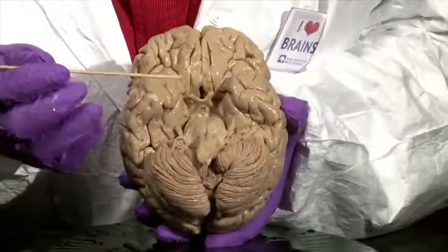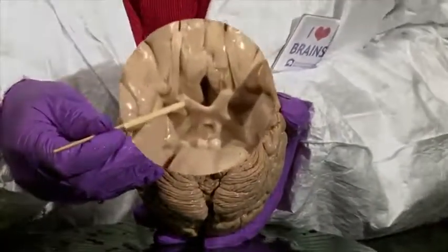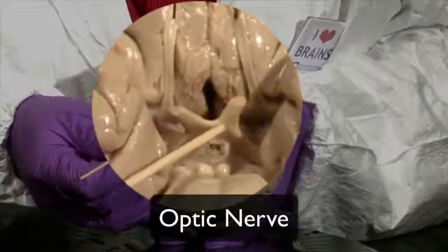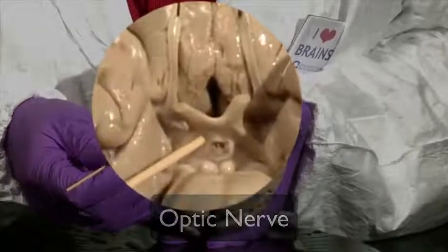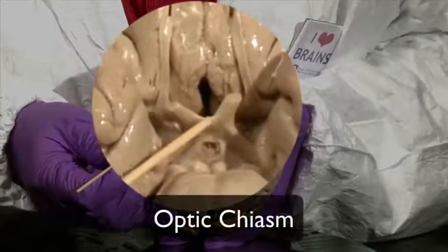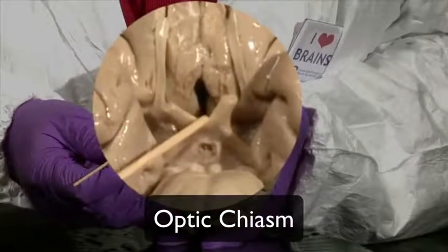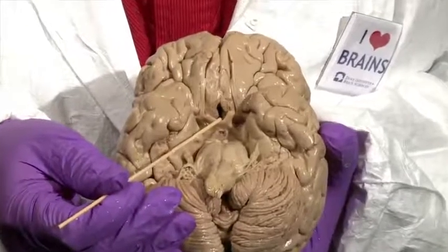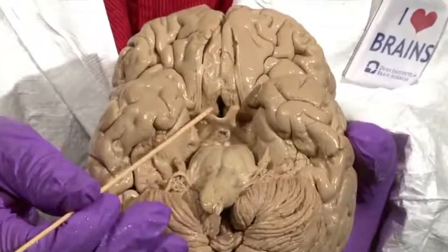The next interesting feature we encounter is the optic nerve from one side and the other that come together and form an X shape. That X shape is called the optic chiasm. Chiasm means an X or a cross, so it's a crossing of the nerve fibers that form these two optic nerves.